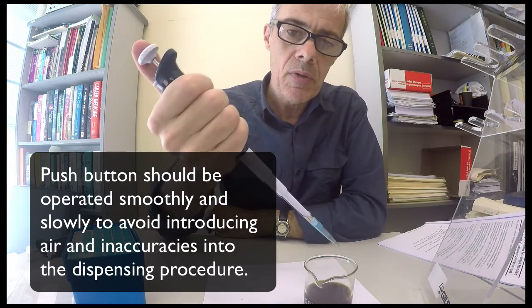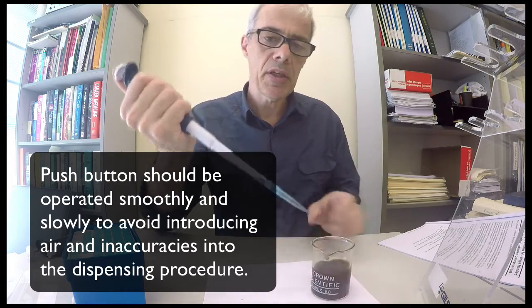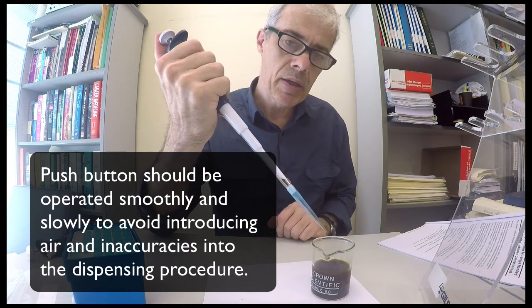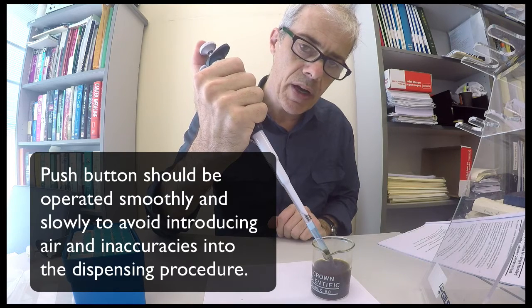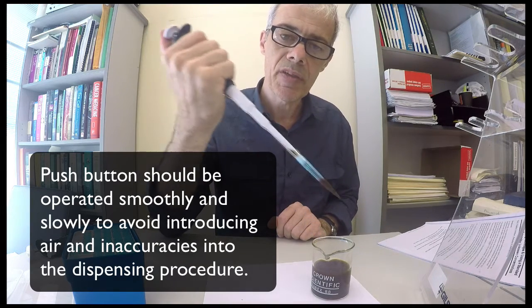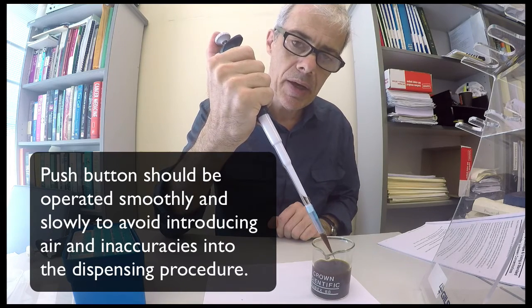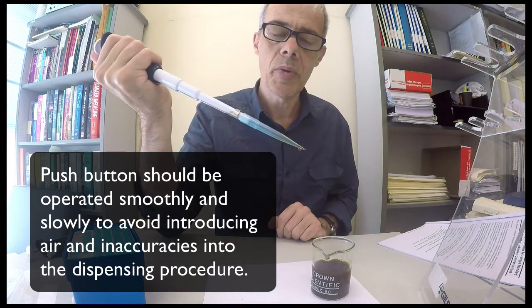So again, to draw up the solution, it's simply a matter of going down to the first stop and then immersing, then drawing up, then transferring to where you want to transfer, and then going all the way down.